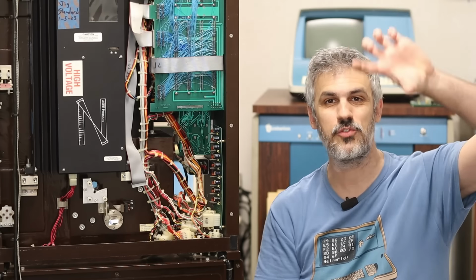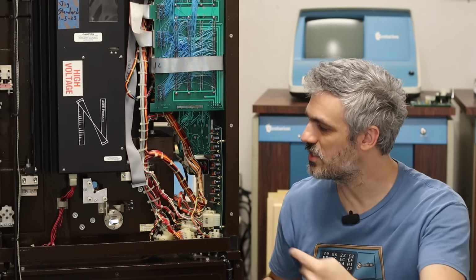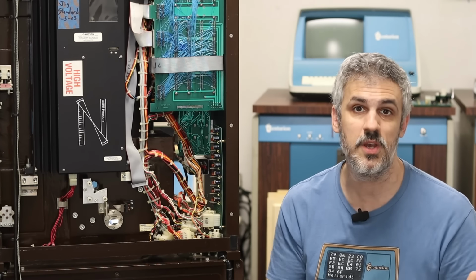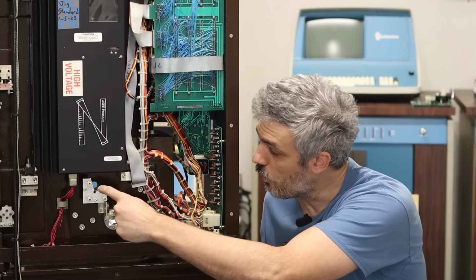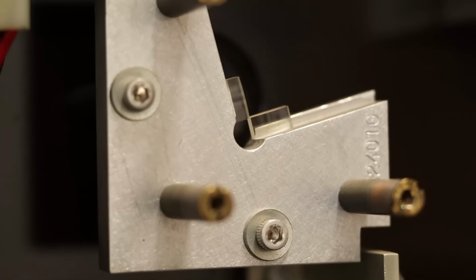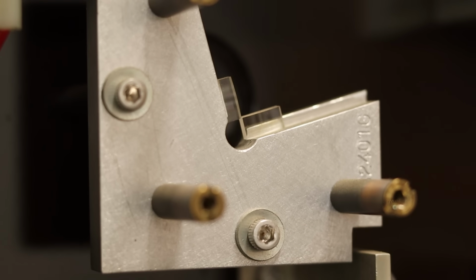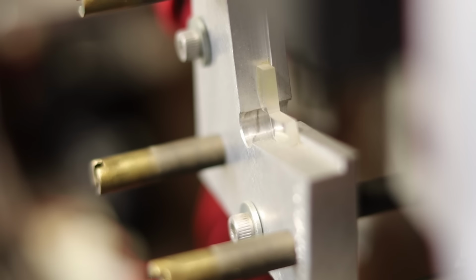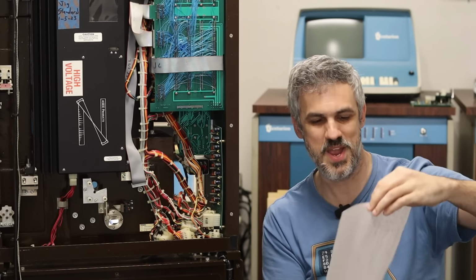So we have a Tetris block of laser light and then a square of white light that is being sent completely through the optical path on the other side. So it hits both the fixed mirror and the moving mirror, passes through the beam splitter, comes back out right up through here, and when it passes through this section here, there are two cylindrical lenses that focus a very tiny portion of that Tetris block of laser light into a tight beam. So that ends up looking a little something like this diagram right here, which I drew by hand.